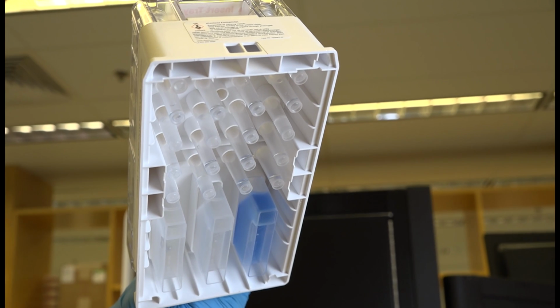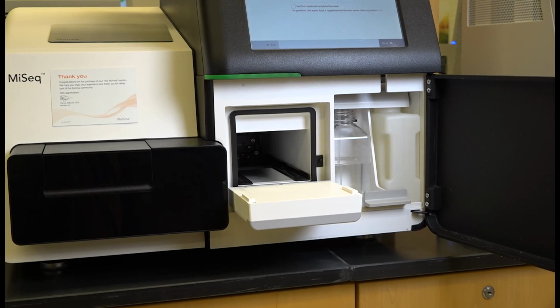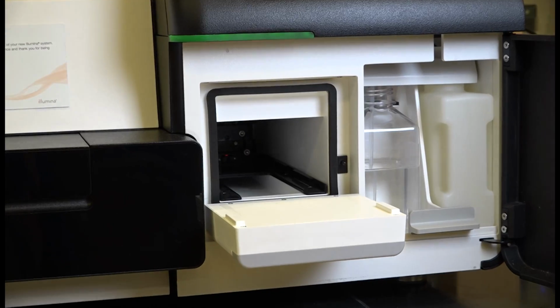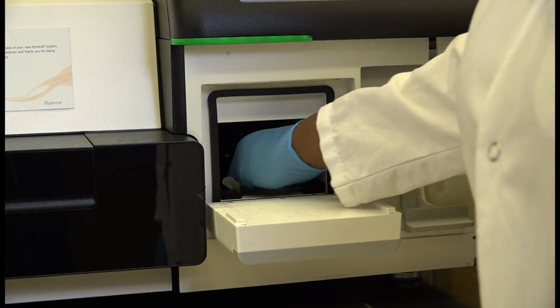Check if the reagent cartridge is fully thawed. Also, inspect the cartridge for any other visible damage or any debris or buildup on the rails inside of the reagent chiller. Wipe the inside of the chiller compartment clean with a dry Kimwipe if needed.